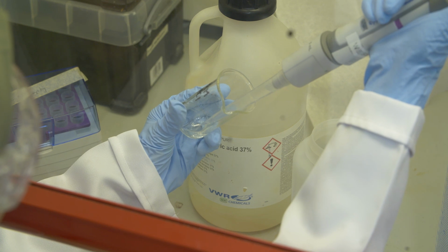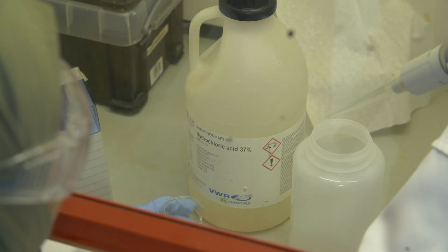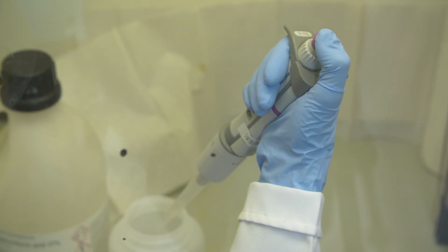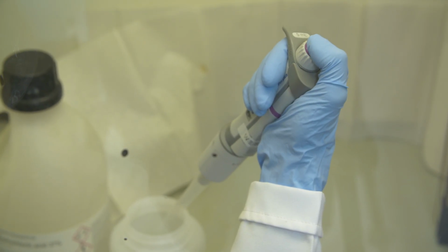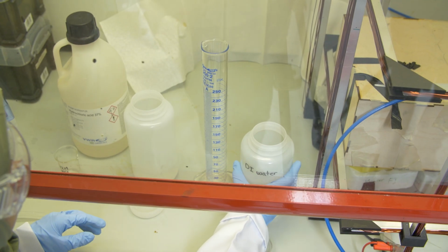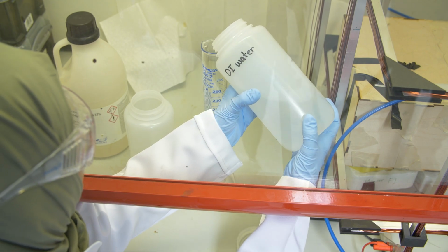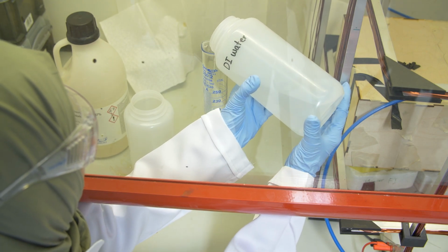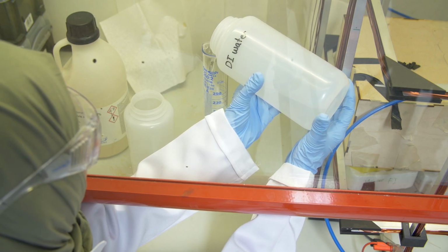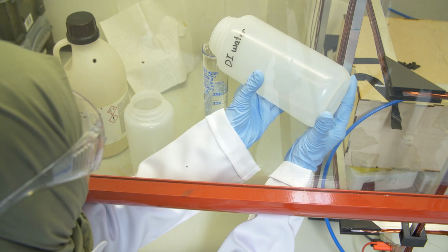She takes it from there, takes up 1 milliliter, and then puts it into the vessel which she actually uses during the experiment. Remember, we always put in first water and then the acid, and you see here how she very carefully pushes down and releases the bottle. Okay, so that's the first part which she did. So the first 250 mils, and now she prepares the second 250 mils.